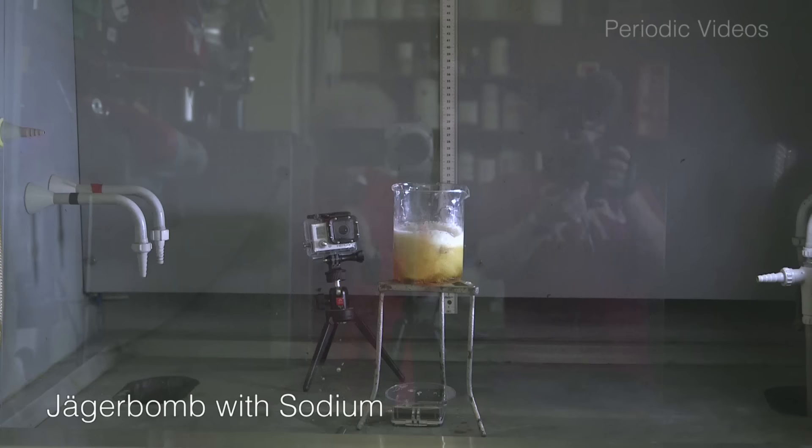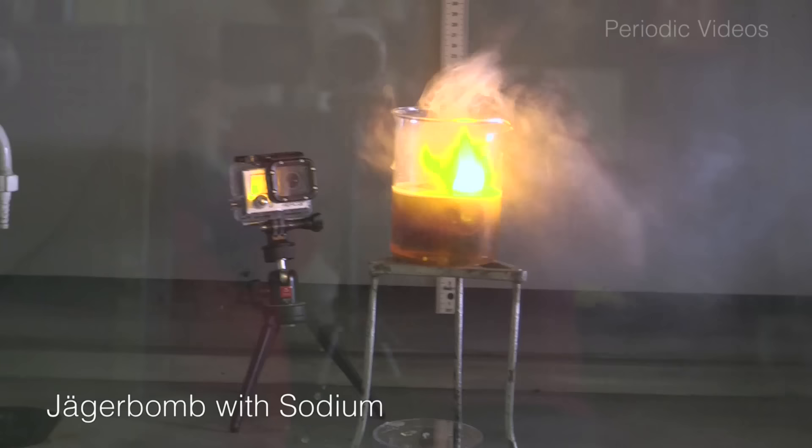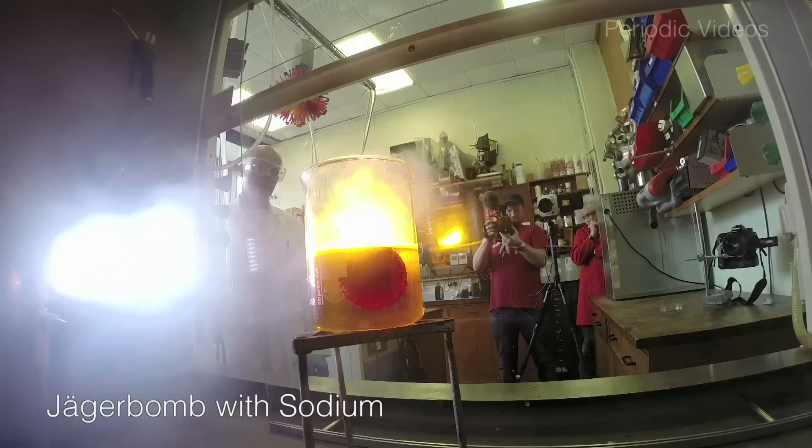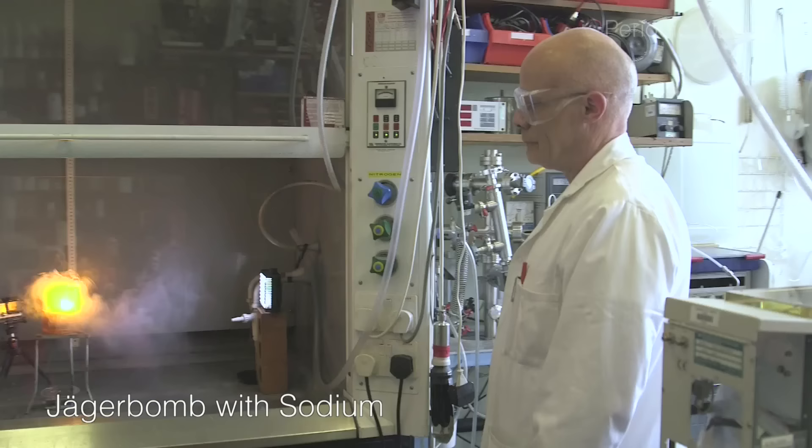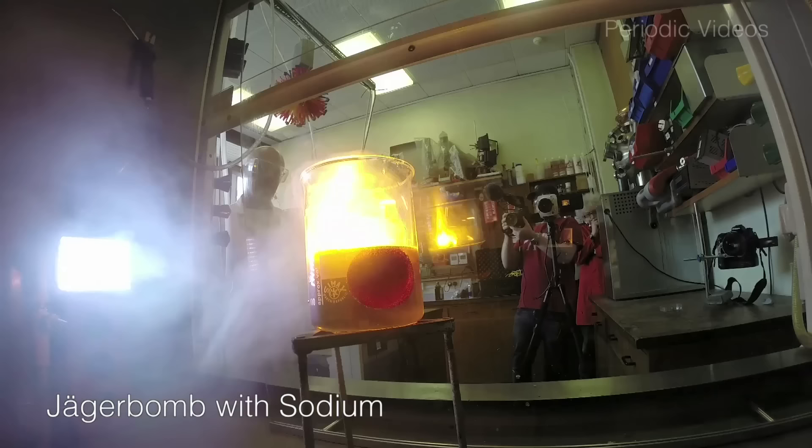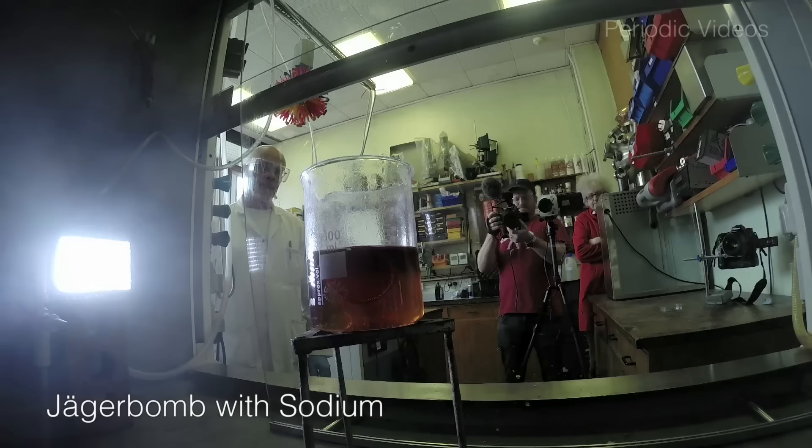We began with sodium, dropped it in. It was a bit of a flop. Not much different from ordinary sodium, bubbling, a little flash and a small pop at the end.